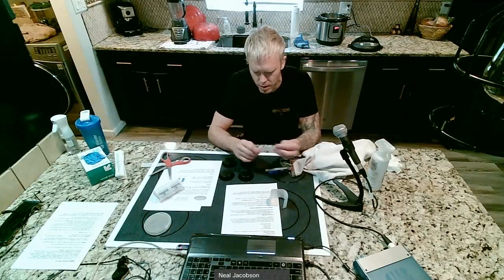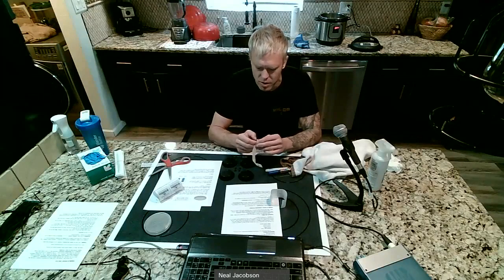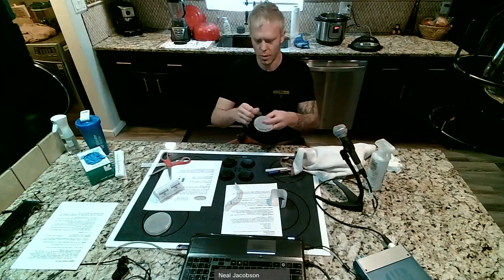Why would we be taking one of those 10 petri dishes and making a control out of it and not opening it up at all? What would that tell us in 5 days? What could that possibly tell us? So in 5 days, we're going to take a look at these dishes again. Okay. Not even going to open it.